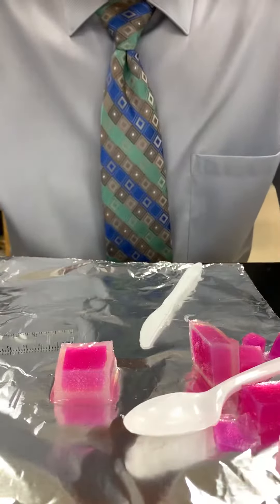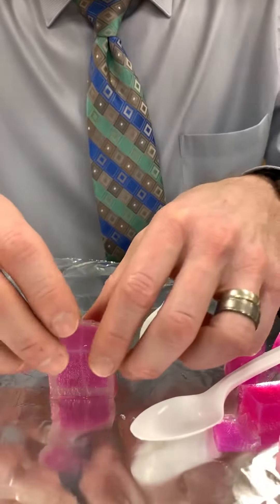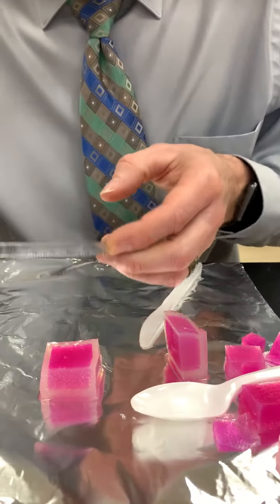We take it out and immediately cut it in half. As soon as I cut it in half, I take my metric ruler.